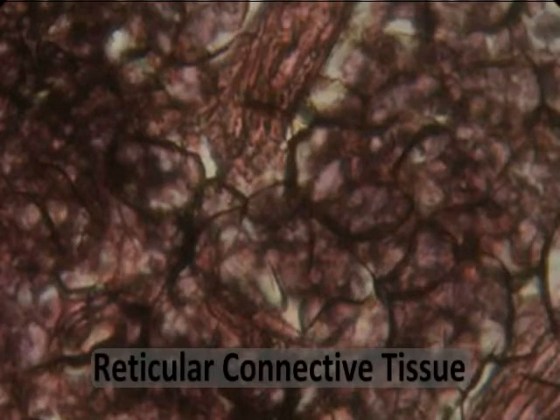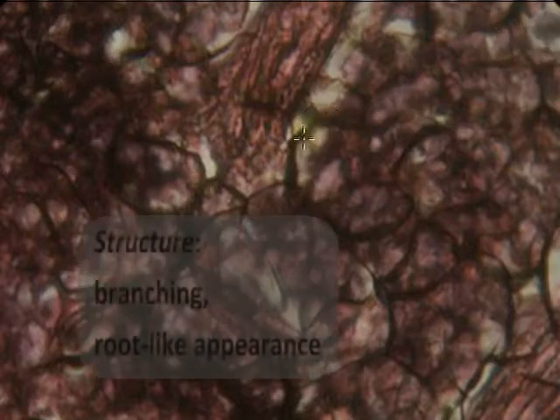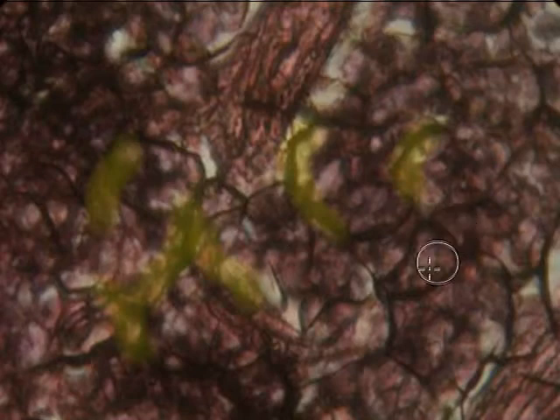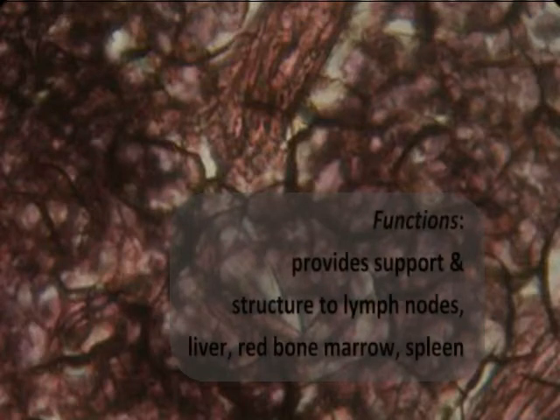Our final loose connective tissue is reticular connective tissue. And the search image here is roots, almost as if you're looking at soil and plant roots under the microscope, where, remember, reticular means branching, and these dark black or brown fibers are the tissue that provides tremendous support and structure to organs like the lymph nodes.